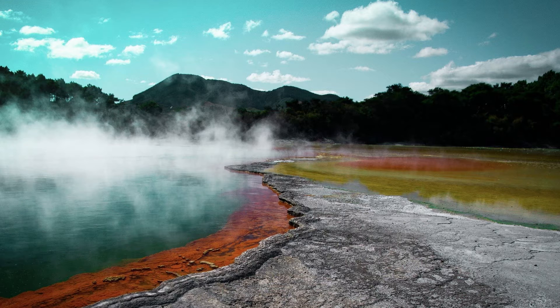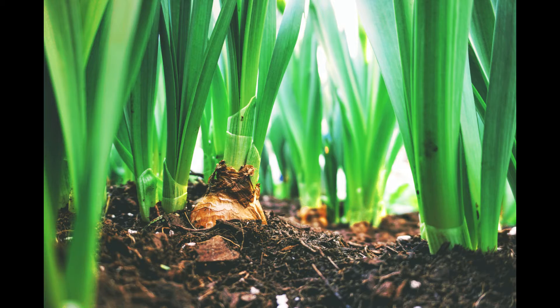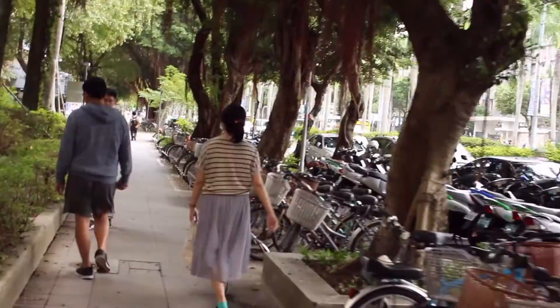But I did hear that they can also be found in normal soil. So today I'm going to try to look for them. Right now I'll just have some soil sample from the sidewalk.